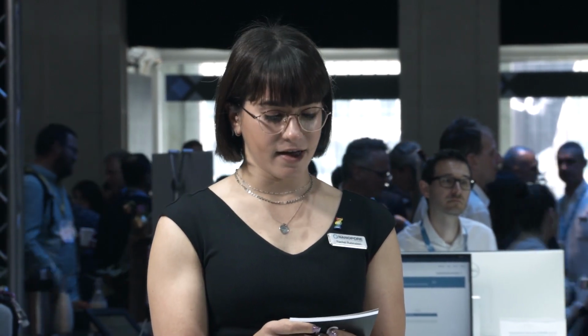These tools are also proving vital for microbiology and infectious disease due to the lower cost per sample and the concentrated effort for surveillance and containment that is enabled by the global deployment of these devices throughout the world and their accessibility. And I think perhaps most excitingly for us here is that it helps us on our mission to democratize sequencing for anyone, anywhere, which is our company's mission and something that we are all quite passionate about.